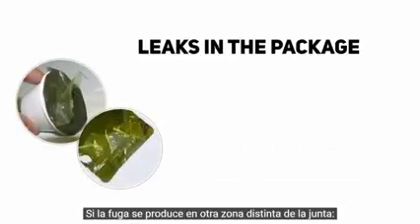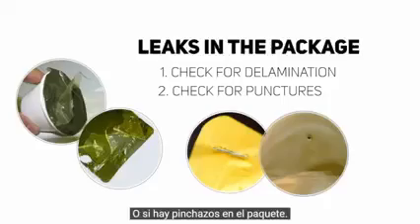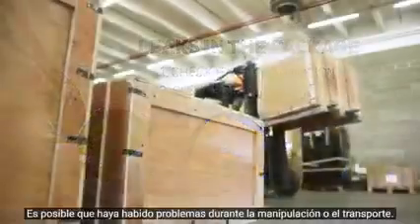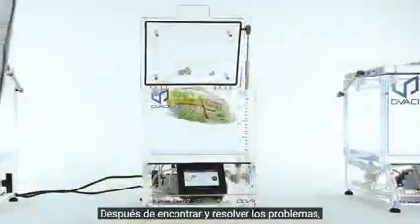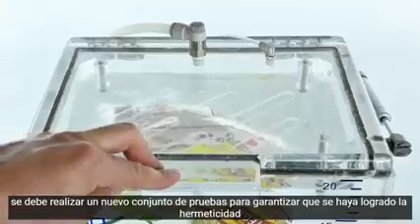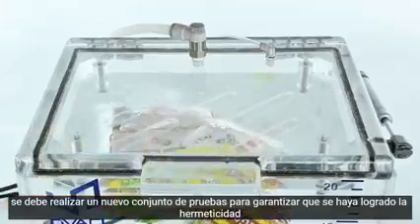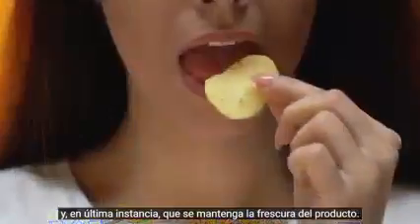If the leak occurs in another area than the seal, check if there is any delamination problem or if punctures are present in the package. There might have been problems during handling or transportation. After finding and resolving the problems, a new set of tests must be performed to ensure that airtightness has been achieved, and ultimately, that the freshness of the product is maintained.